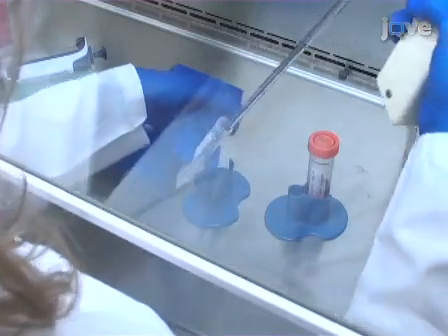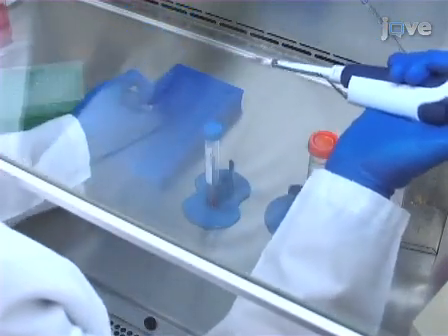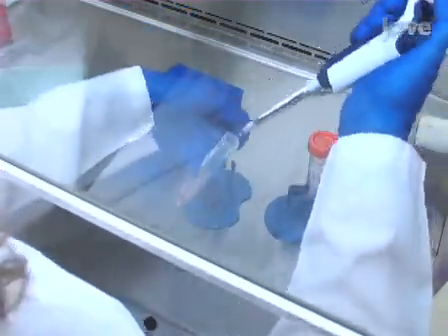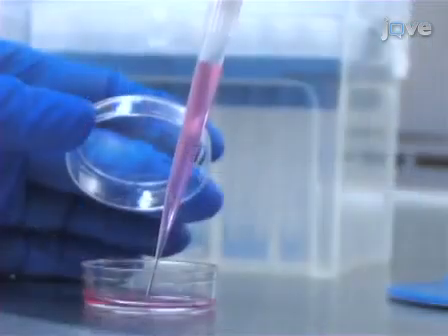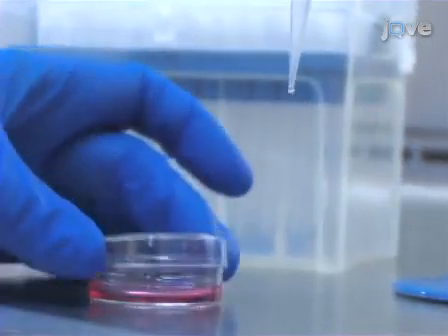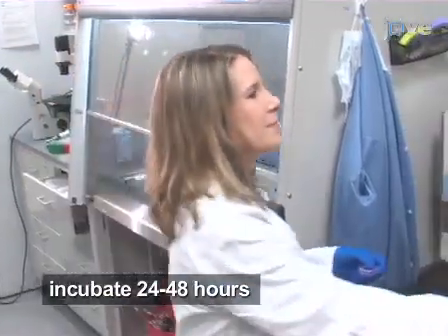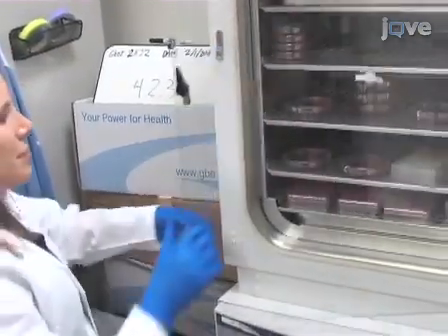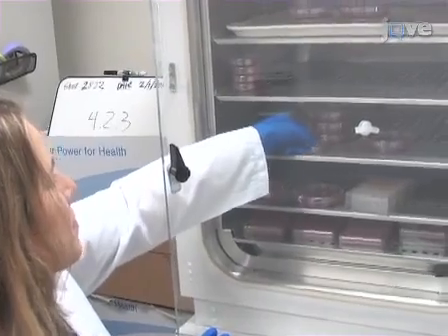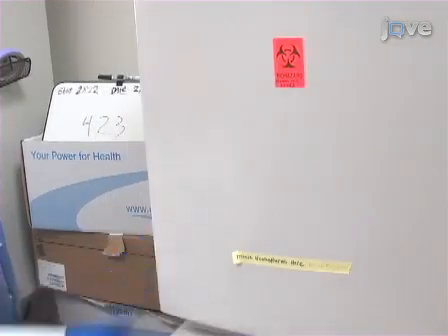First, dilute the viral supernatant to the required multiplicity of infection in fresh, complete culture medium, supplemented with 6 micrograms per milliliter of polybrene to a final volume of 1 milliliter. Aspirate the media from a 35 mm dish of target cells and add 1 milliliter of diluted viral supernatant. Incubate in the tissue culture incubator for 24 to 48 hours to allow sufficient expression of the SLC7A1 receptor. If desired, use antibiotic selection with blasticidin to select for stably transduced cells expressing SLC7A1 according to the instructions in the written procedure.